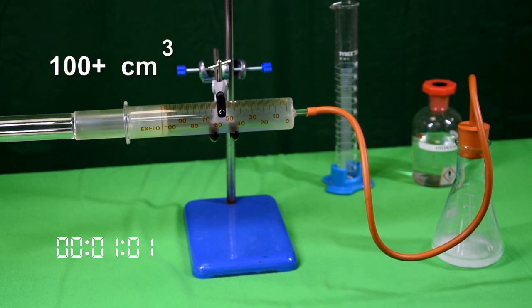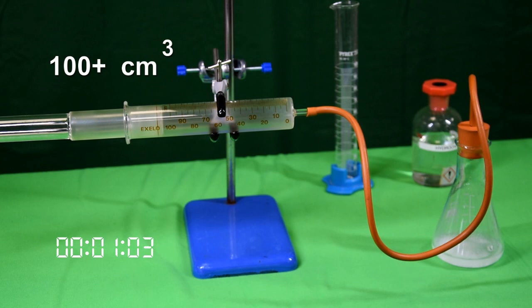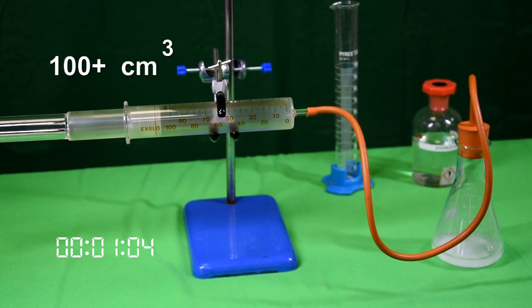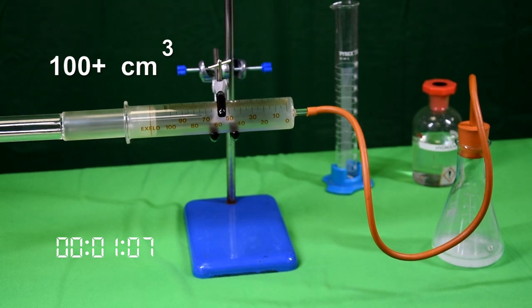At 60 seconds, the volume of gas produced has already exceeded the capacity of the syringe.